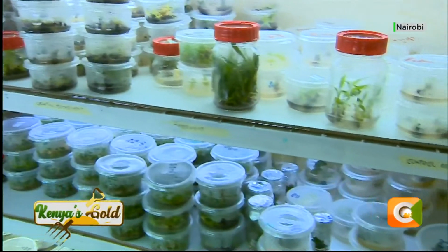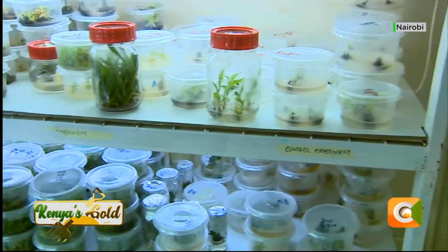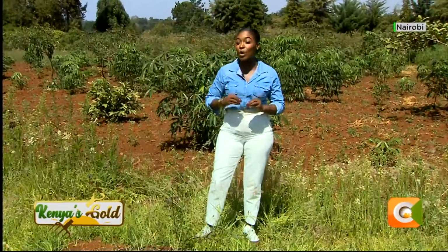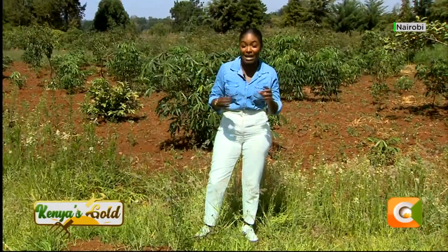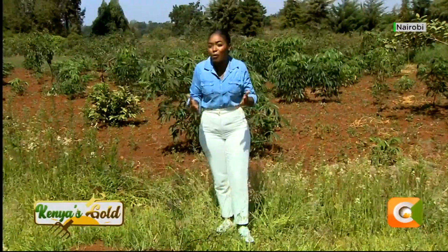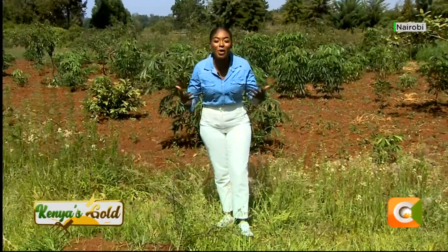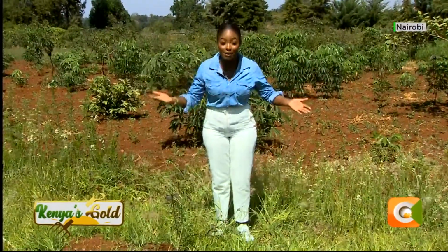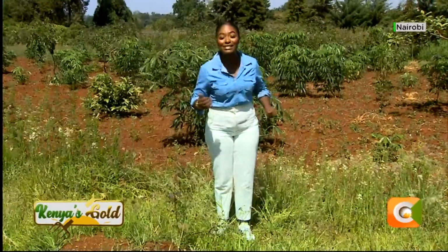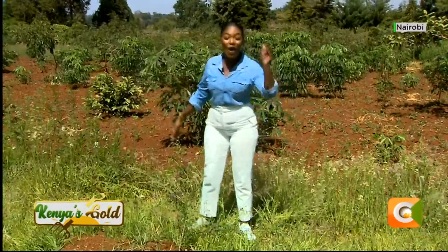This process happens in the lab by mimicking a natural environment for the crops and also supplying them with the correct nutrients and hormones at different stages for them to grow as they should. So how does this process happen? How long does it take? What is the technology involved? And if you were to compare tissue culture and cuttings, what are the benefits of tissue culture? All those answers will be coming through to you on our feature starting right now.